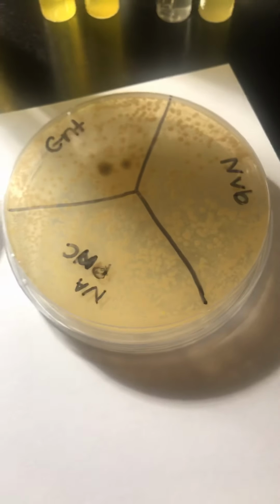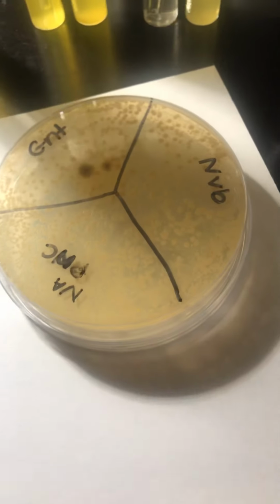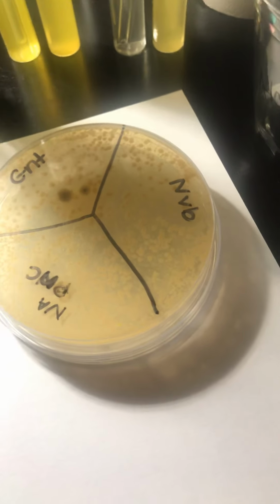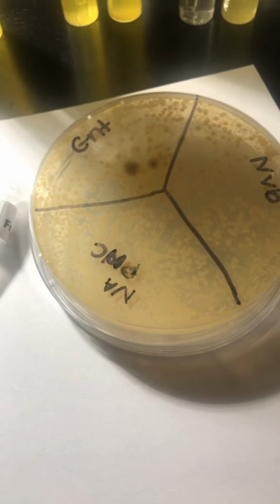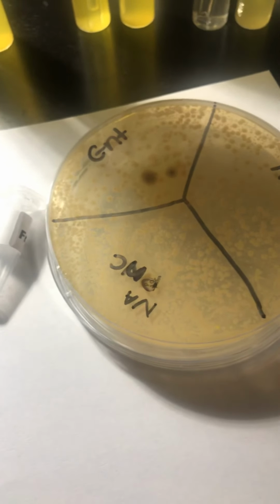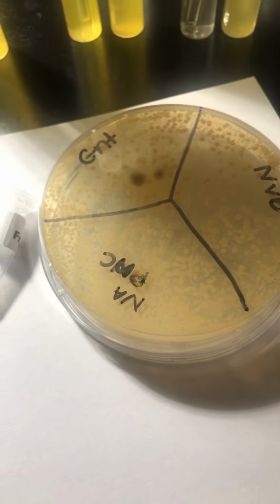I would put 8 drops of the S. epidermidis on the agar, and then I would make sure that I had spread it evenly, which I'm going to show you right now how it looks. This is what it's going to look like. And then I would use a tool, which is an L-shaped spreader, to spread the broth evenly across the agar, so that the entire plate is coated with an even layer.